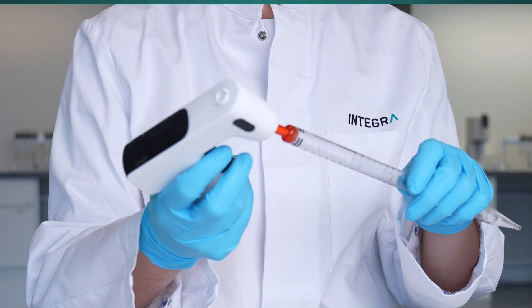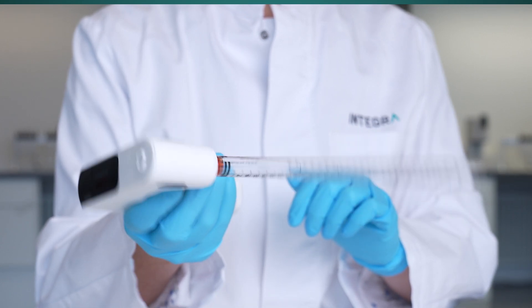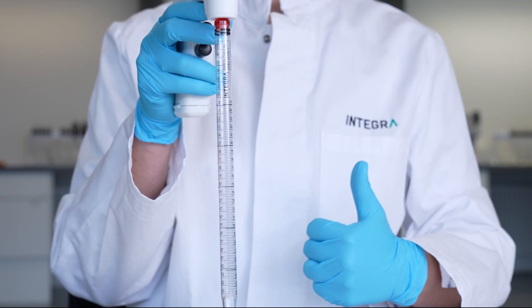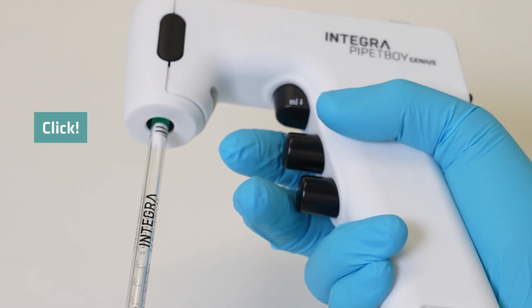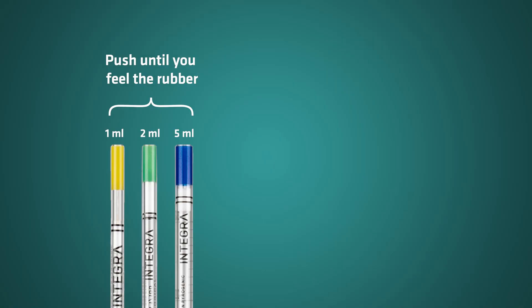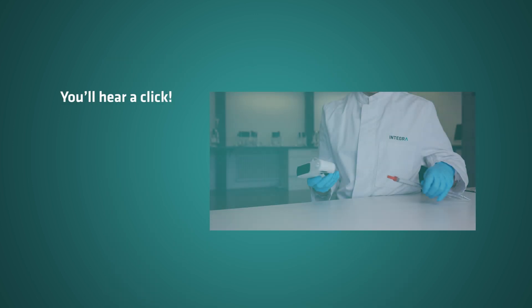The Pipette Boy Genius features the innovative Steady Grip feature, which ensures an optimal solid grip for any volume pipette. It requires a small amount of force to insert the pipette—push until you feel the rubber for 1 to 5 milliliter pipettes, or until the pipette's shoulder touches the clamp for 10 to 100 milliliter pipettes. You'll hear and feel a click when the pipette is correctly inserted.